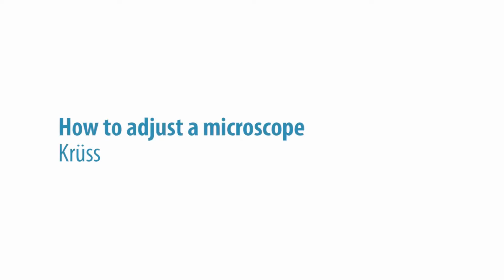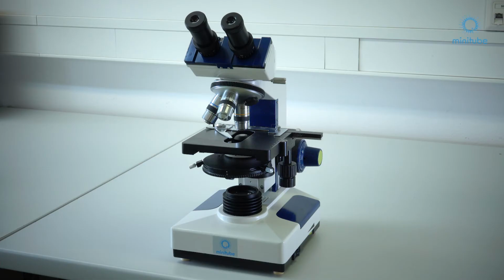Hello everyone, I would like to show you how to set up a Krüss microscope. This video shows the Krüss MBL 2000, but all the other Krüss microscopes have the same functional elements. At first, I would like to show you the basic elements of the microscope.